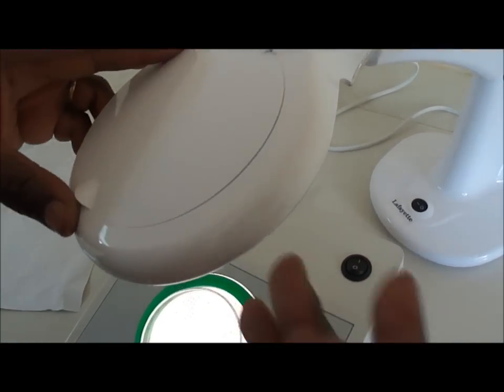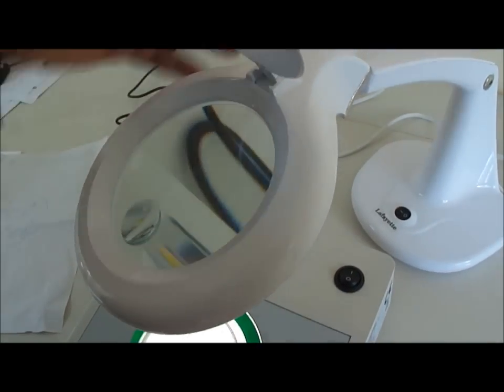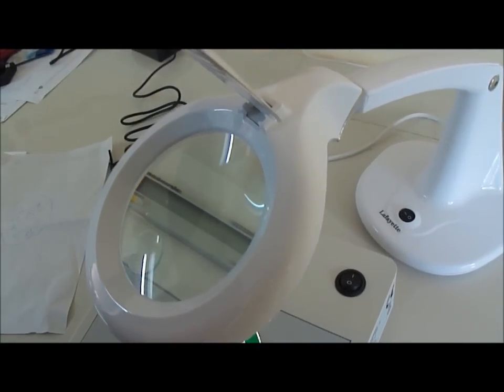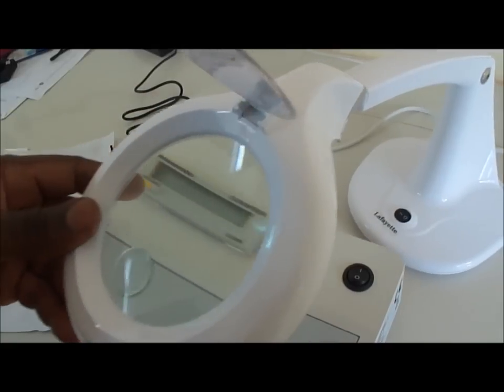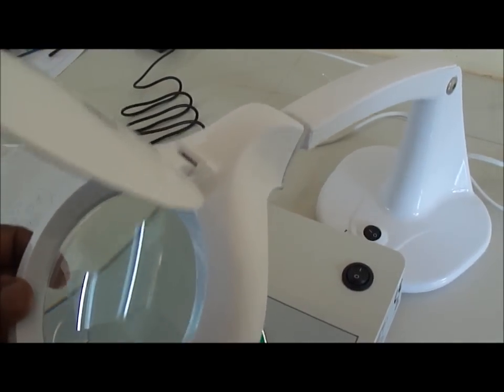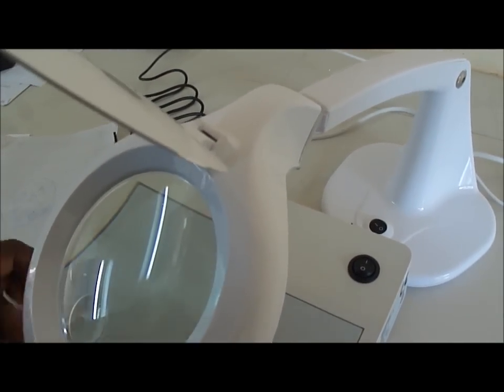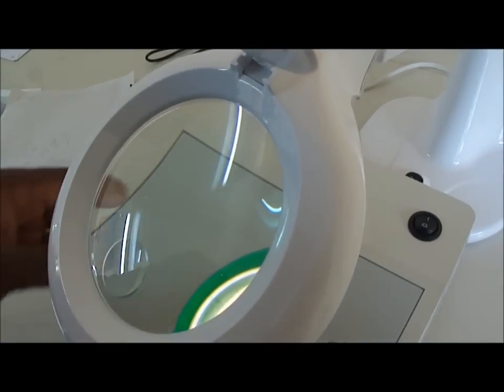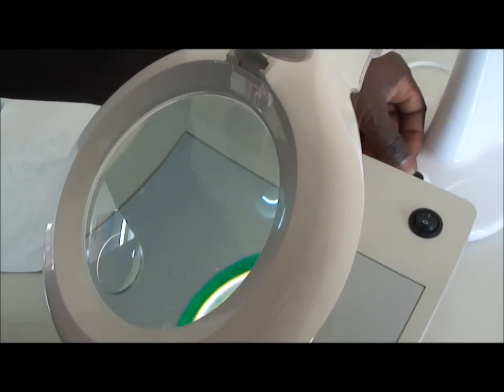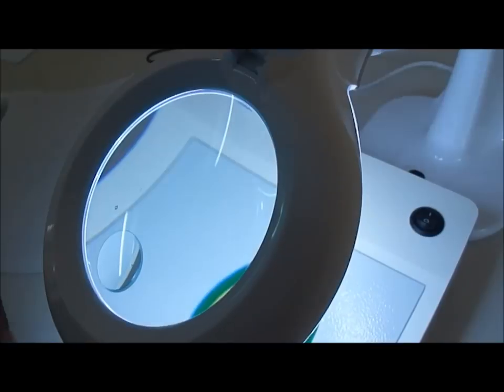And you bring this, you connect the model, it has electrical connection also, in front of, you bring the magnifying glass in front of your plate, and then you can, if the light is not enough, you can light it up.